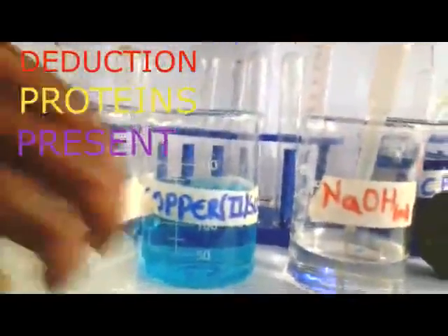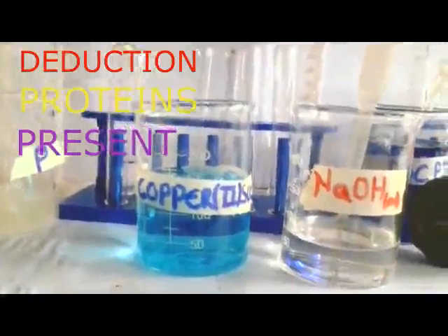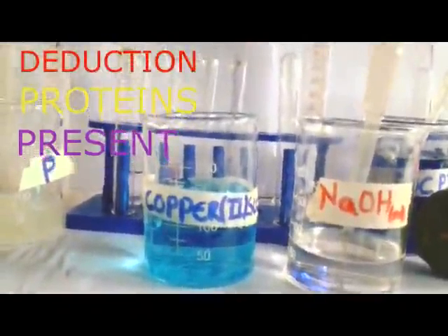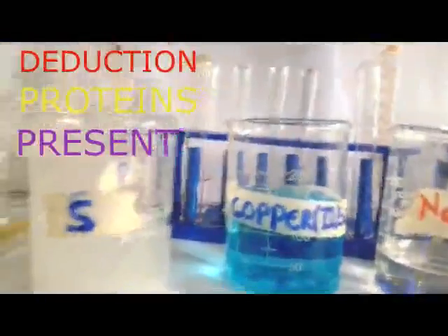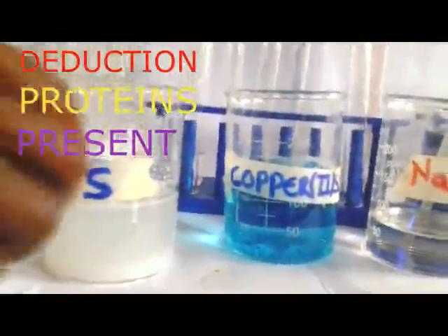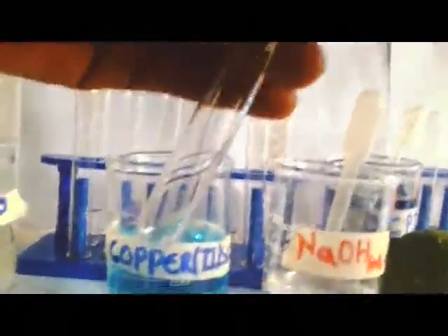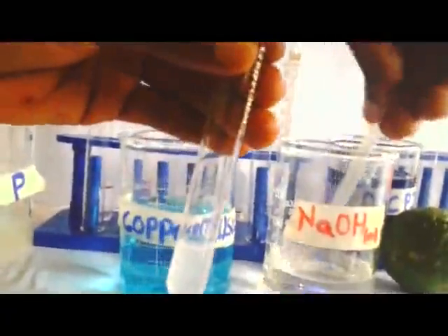Now we are going to carry out our negative test. Assuming I use a solution for starch. The other one which we used for starch, that was our solution S which we made. That was solution S, which gave us good results for starch. Then let me try to use it and you see whether we can get the same observation. Now I put my solution S like that. I've not measured using a measuring cylinder. Then I also put sodium hydroxide.